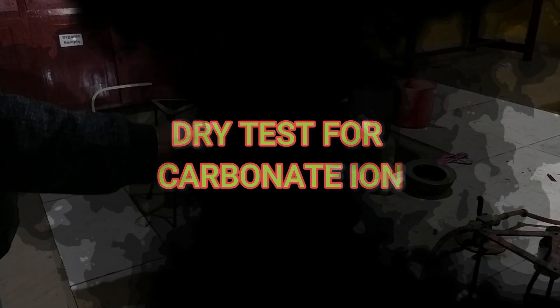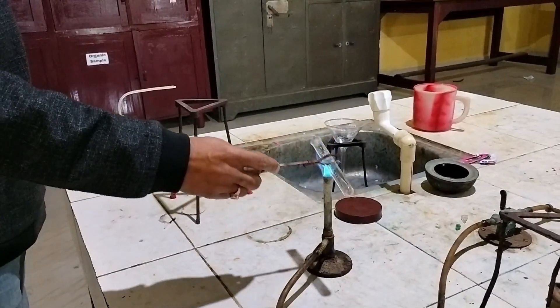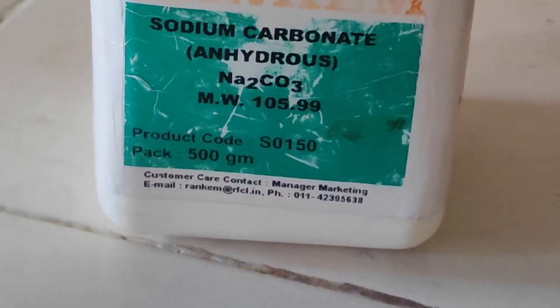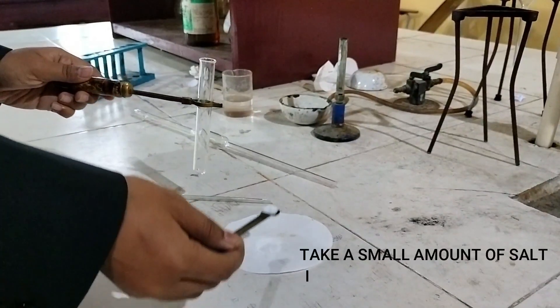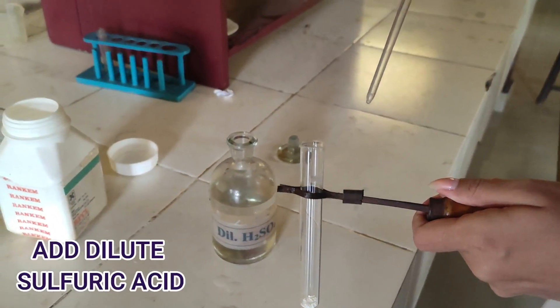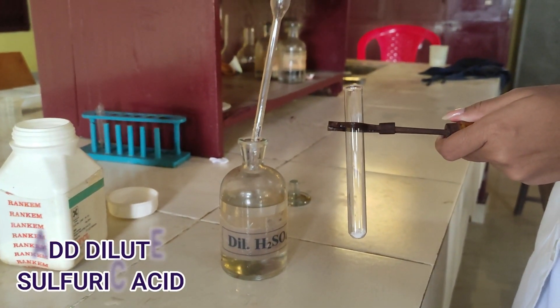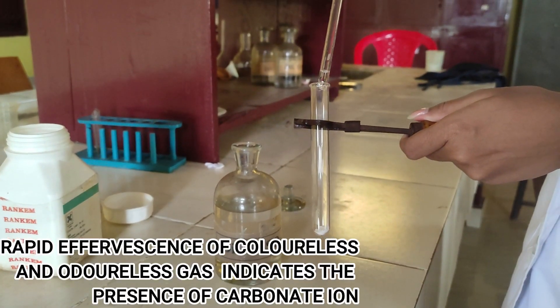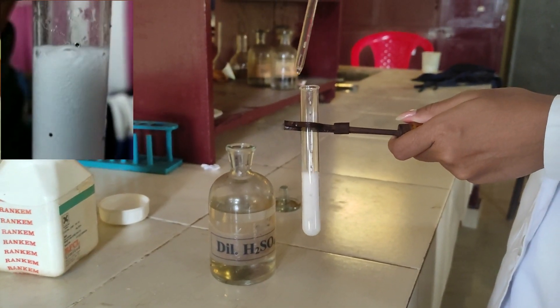Let's start with the carbonate test. For this, we need a dry test tube. The chemicals required for this test are salt and dilute sulfuric acid. Take a small amount of salt in a dry test tube, then add dilute sulfuric acid. Effervescence indicates the presence of carbonate.